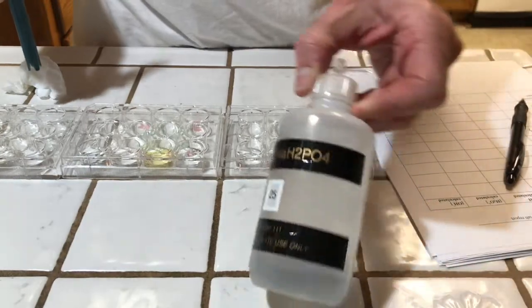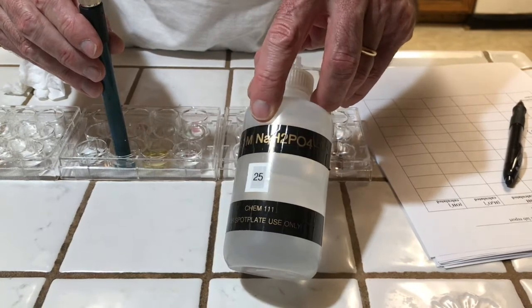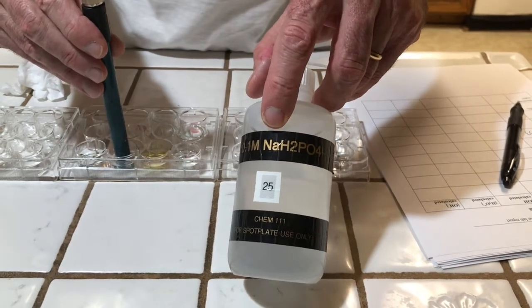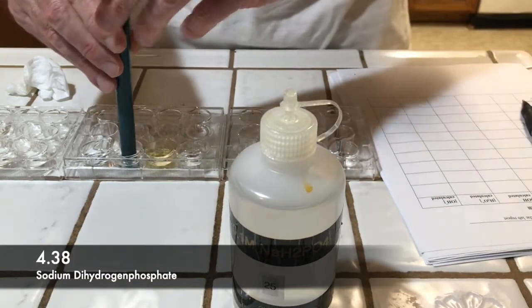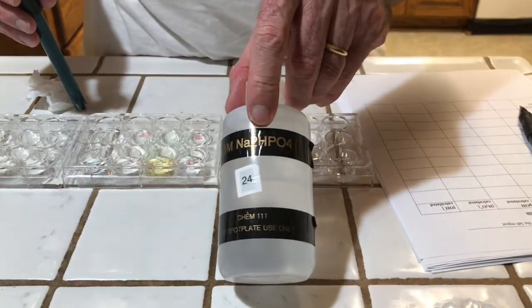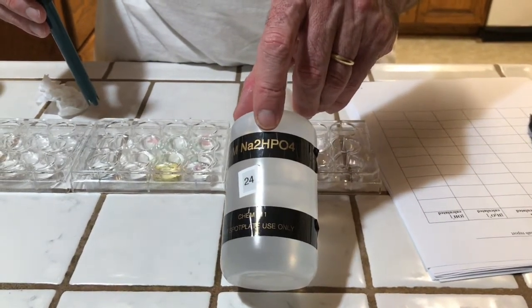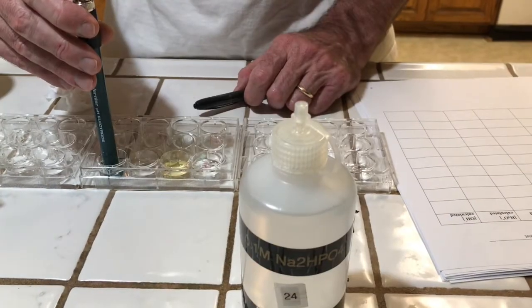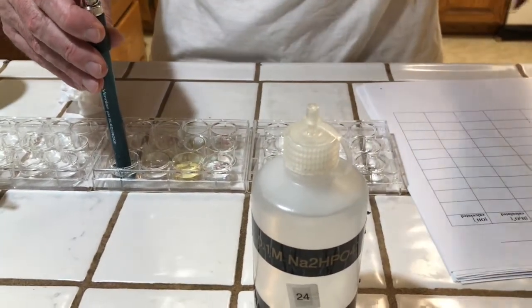Next we have sodium dihydrogen phosphate. Dihydrogen phosphate comes from phosphoric acid, which is a triprotic acid, and of course the sodium from the sodium hydroxide. pH 4.38. Next we have sodium monohydrogen phosphate. So this is similar to what we just did. However, we've removed one of the hydrogens and stuck on another sodium. Whereas the dihydrogen phosphate was acidic, the monohydrogen phosphate is basic, 8.43.